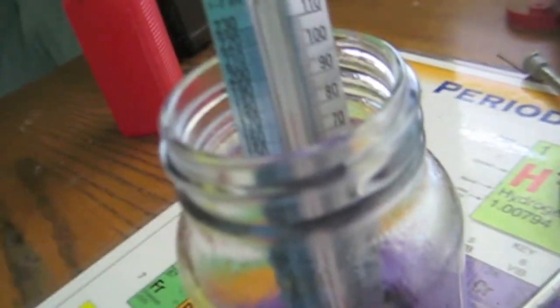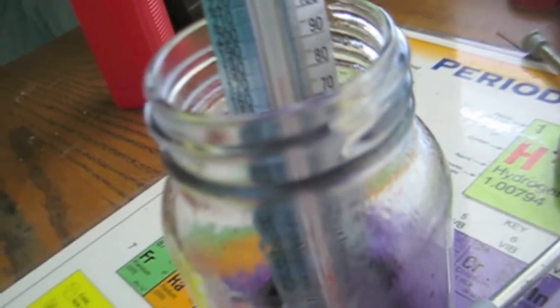That reached about 105 degrees Celsius or 210 degrees Fahrenheit. That was really interesting. So we have left in here some black weird stuff. This is what it looks like after adding 10 milliliters of water and mixing it up. So now instead of being purple, it's a brown color.